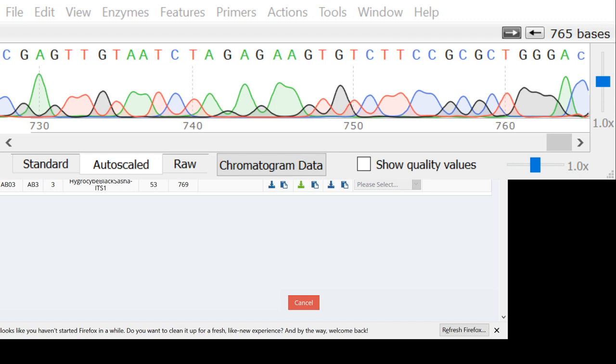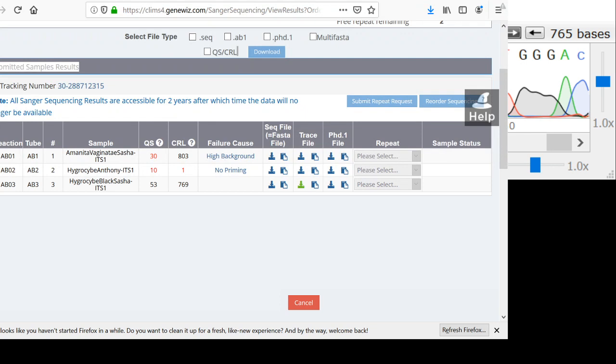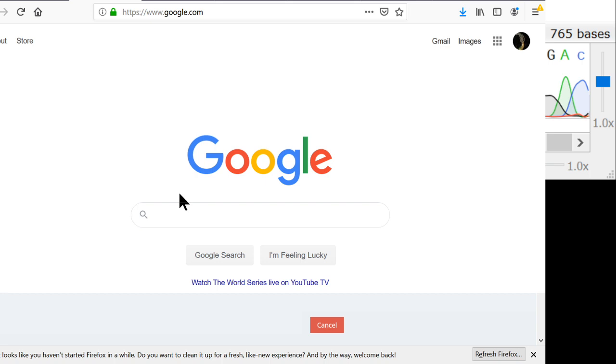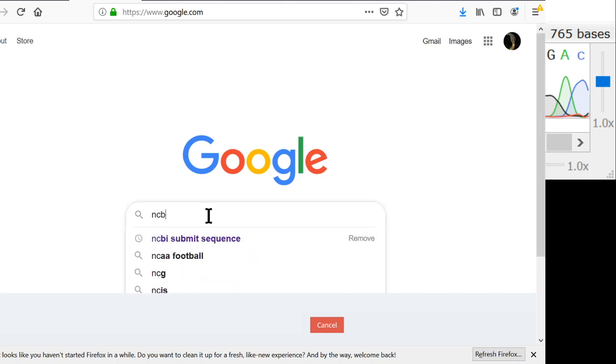Let's see, or maybe I can just move Firefox up. Yes, that worked. So now here is Firefox, and what I want to do is go to NCBI BLAST, and to do that we can just Google NCBI BLAST.